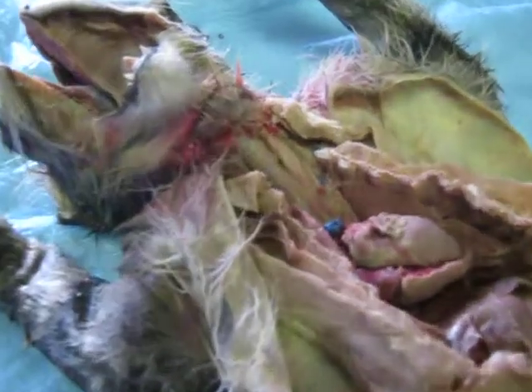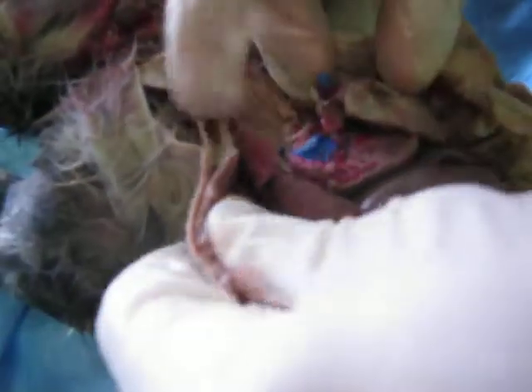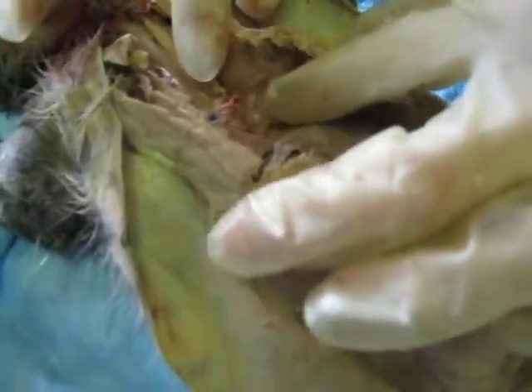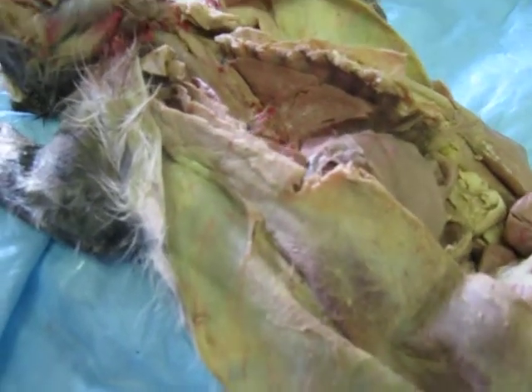Okay, here are the left and the right lungs. Those are the main holders of air in the cat. Sorry, I'm just going to set the heart right there for now. And the diaphragm is this whole area, including there's usually a cover over the heart.